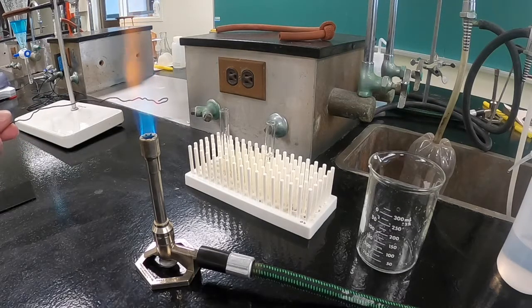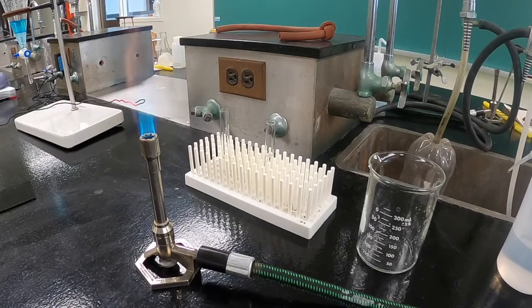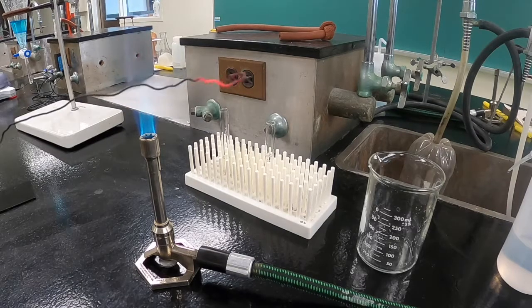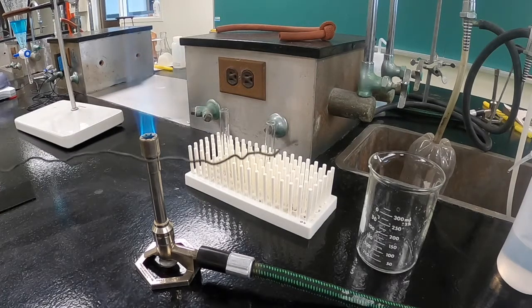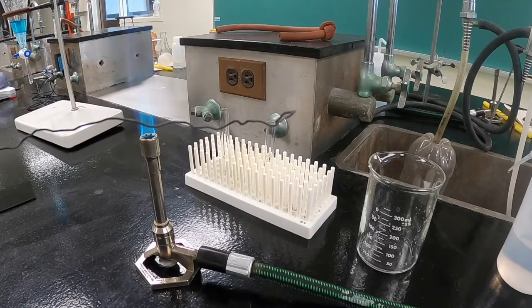Once the flame color stabilizes, remove the wire from the flame and allow it to cool. And this will almost certainly take longer than you expect it to.